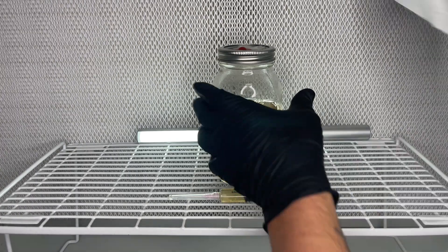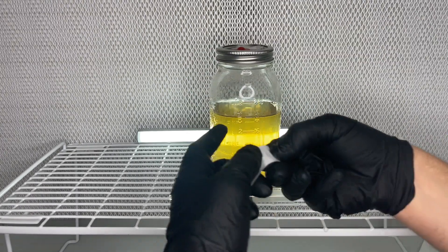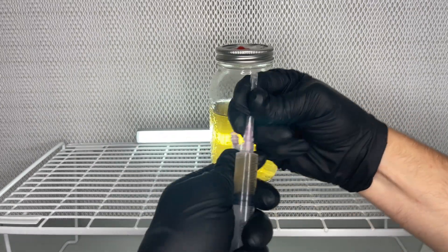So if you have a mushroom liquid culture syringe that is completely contaminated on agar, but you still want to grow the mushrooms, here's one way that you can actually save the mycelium.